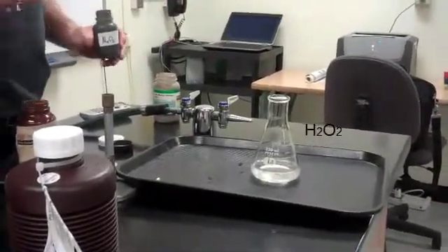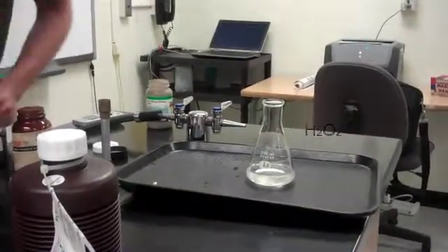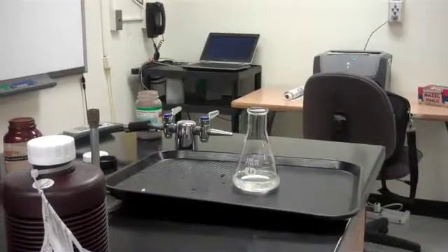So we have the 40% hydrogen peroxide, and I'm going to add the catalyst to make the reaction happen faster. I also want to test for the presence of oxygen on the board, and so I need a glowing splint. Grab one here.